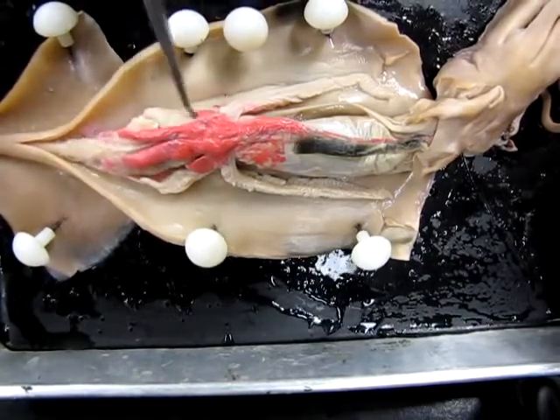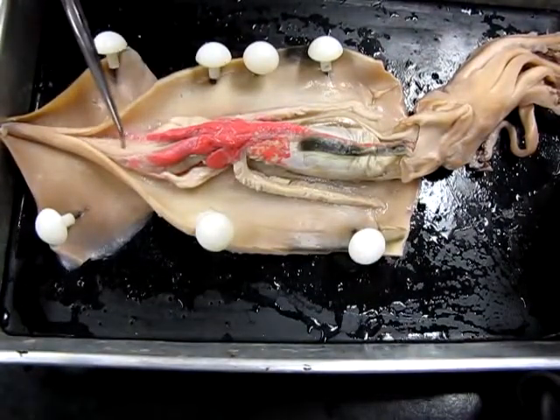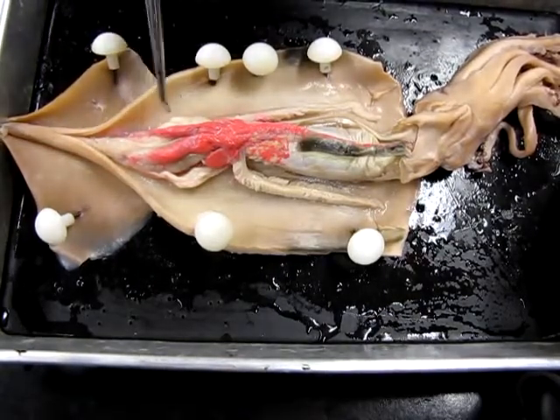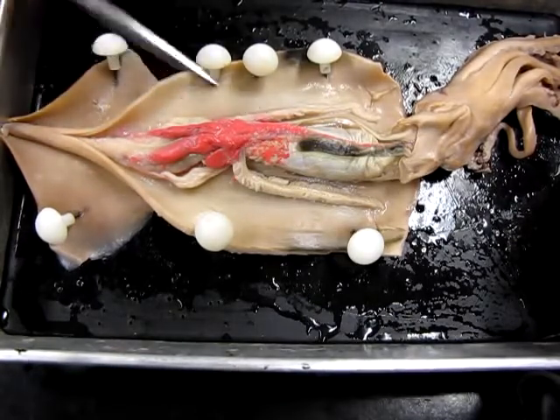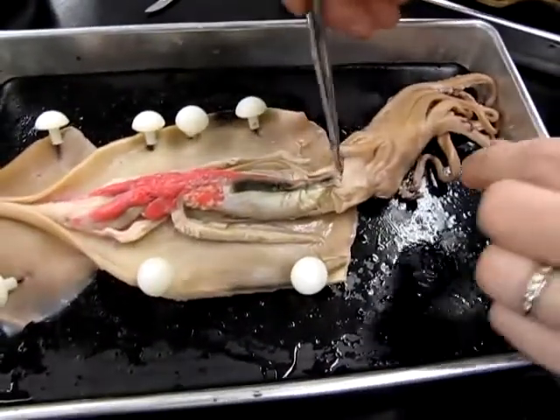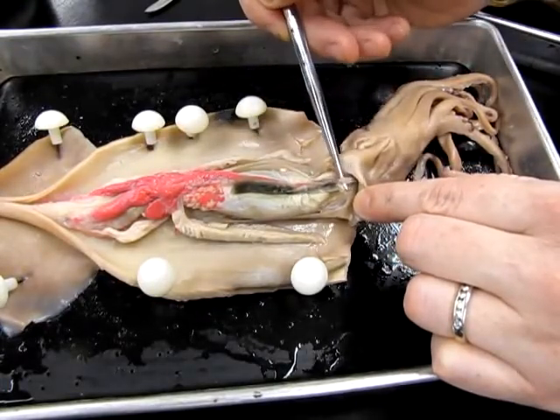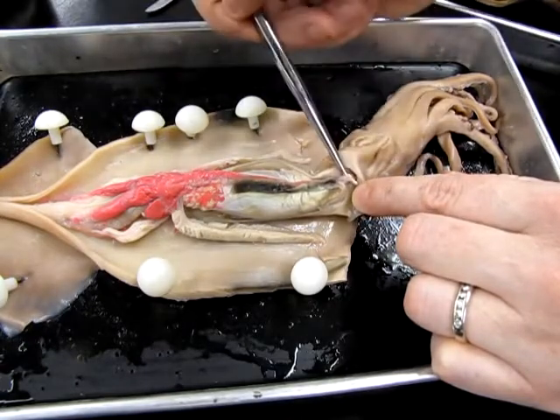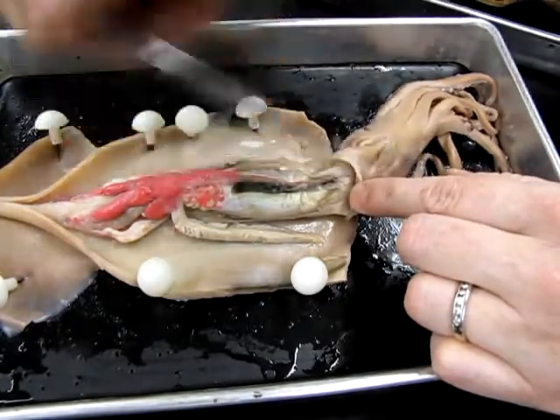That is the stomach. It is in close proximity with the cecum, which is this long whitish soft bit right here that produces different digestive enzymes, so that's involved in food digestion. Once food is digested, there is an intestine that passes down the length of the body. A lot of it's hidden by some of these other structures, but if we go down far enough towards the siphon, we can find right here there's a small tube. That's actually now the rectum at this point. So the intestine passes all the way down to the rectum and anus, and then again the waste material is ejected out through the siphon.